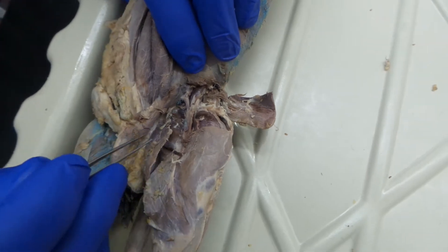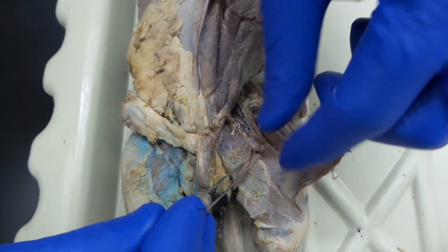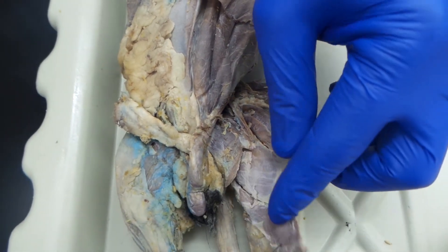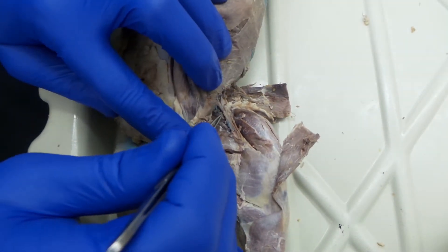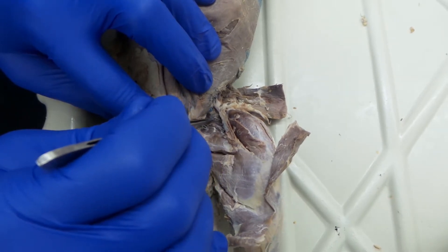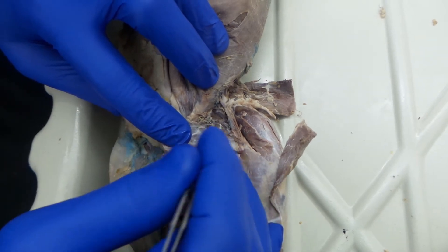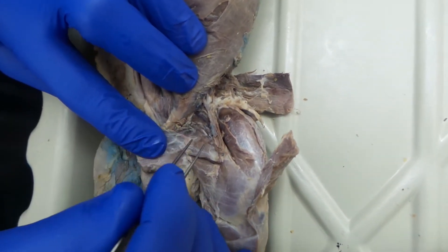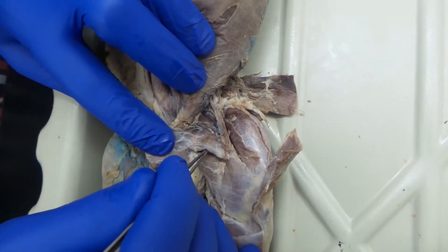If we move across to the other side of the veins, we're looking at this big, large, flat muscle. We have the sartorius at the top, gracilis at the bottom — so cut through that gracilis. And we have a handful of smaller muscles right along the vessels here. Lift them up: you have right there the pectineus, and then from the pectineus you have the adductor longus, the adductor magnus, sometimes called the adductor femoris.